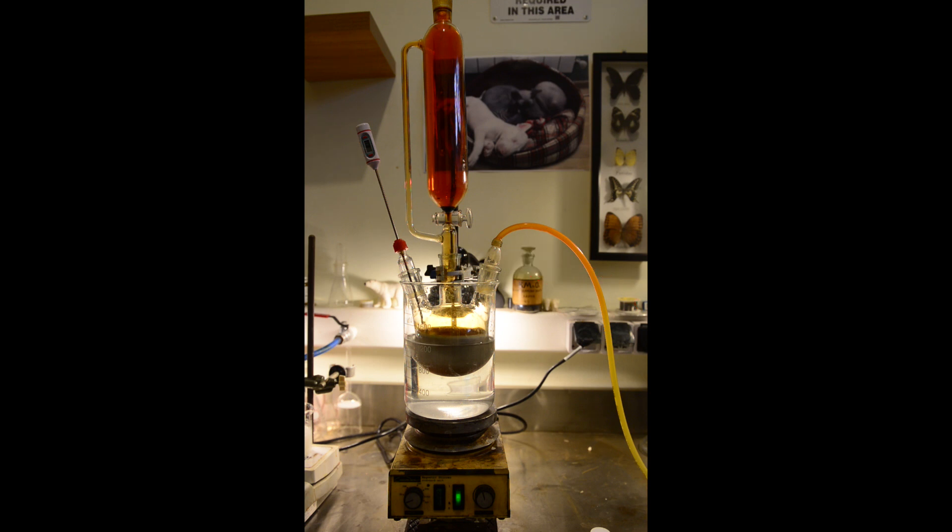During the reaction as a byproduct methyl bromide is formed. At the beginning I was planning to collect this valuable organic substrate but condensation of liquid with such low boiling temperature requires much more efforts and I wasn't prepared for that. Maybe next time.